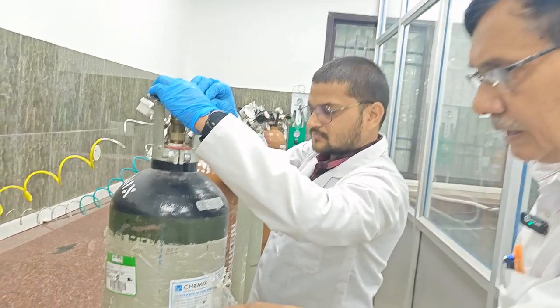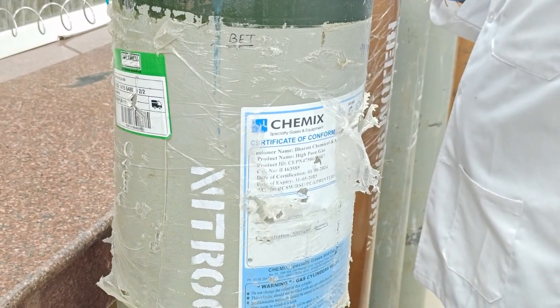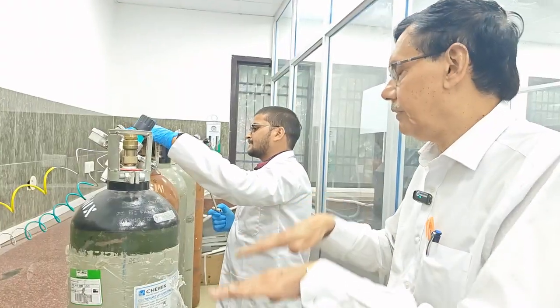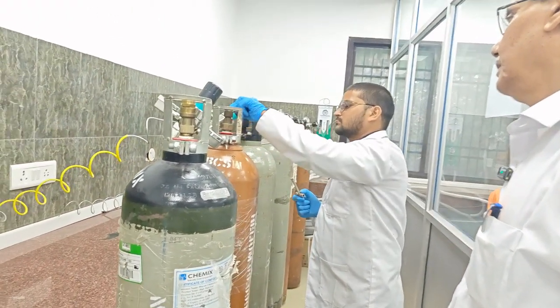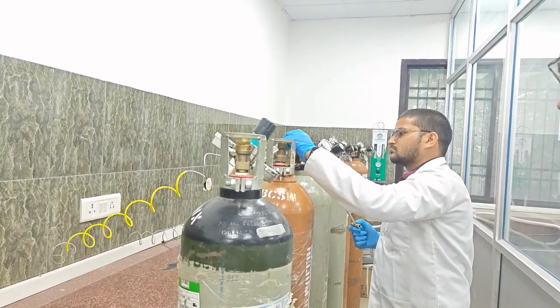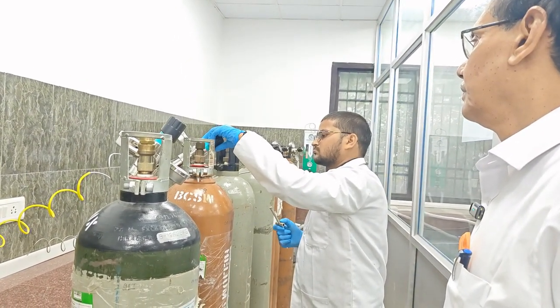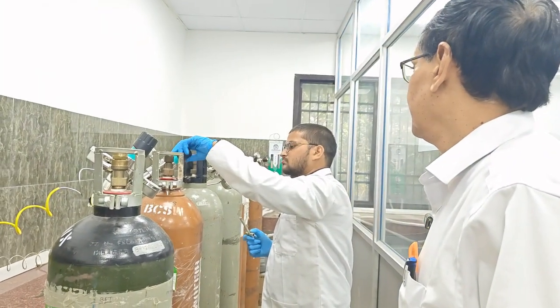High pure gas, because for this adsorption we need very pure gas, because the gas is adsorbed on that surface. So we have to be very careful while handling all these gases.